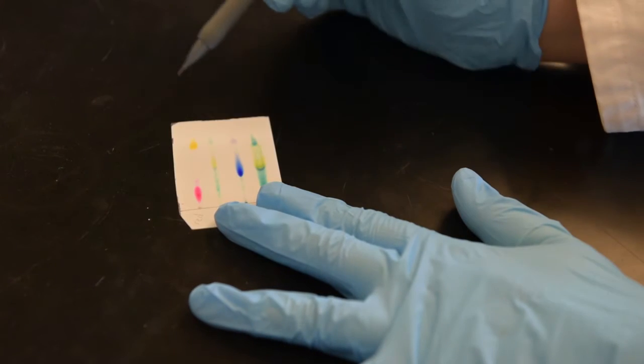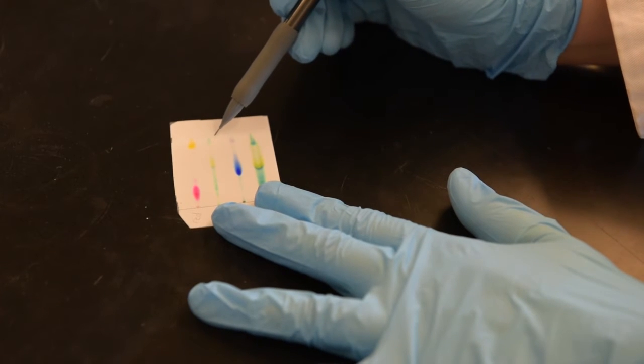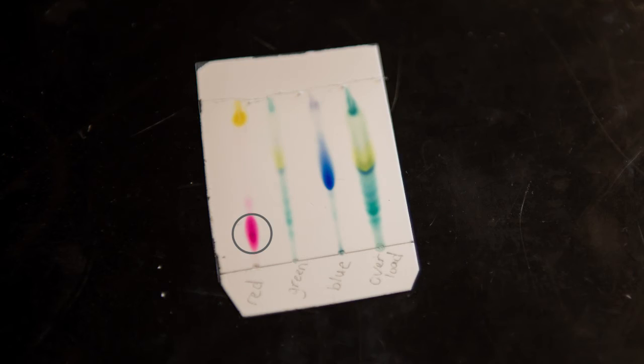Once you remove the TLC plate from the TLC jar, quickly trace the solvent line with pencil. Since the analysis considered Sharpies, the components are visible without UV light. Wait until the solvent dries and then circle the migration spots. You will be able to tell when the silica gel is dry, since you will be able to see the solvent evaporating. Be careful when you are doing this as to not damage the silica gel.